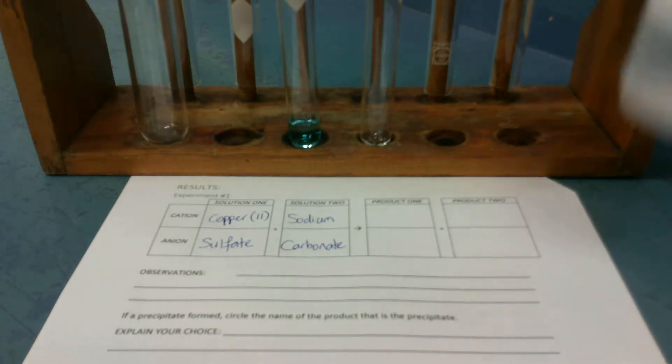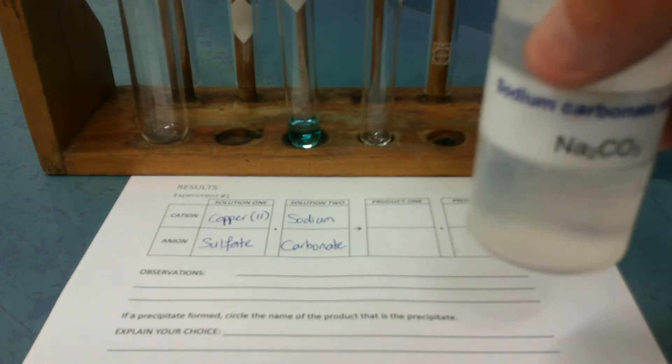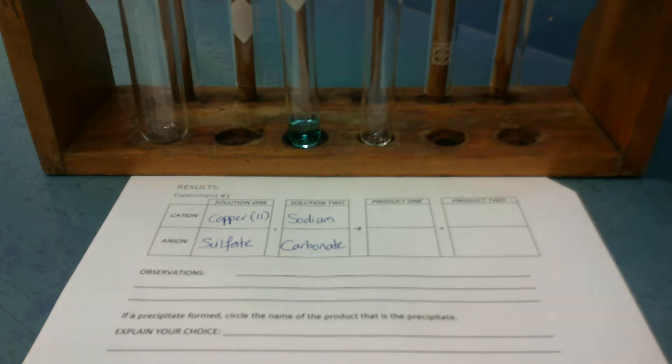And then I'm going to add a few drops of the other chemical. It's solution 2, and I'm going to only add a few drops to it.